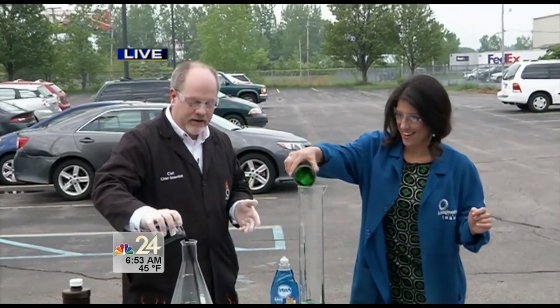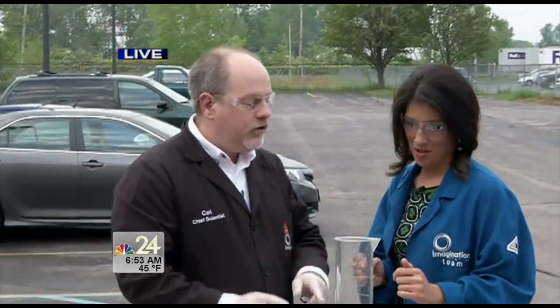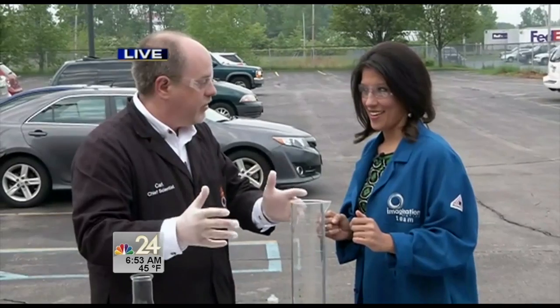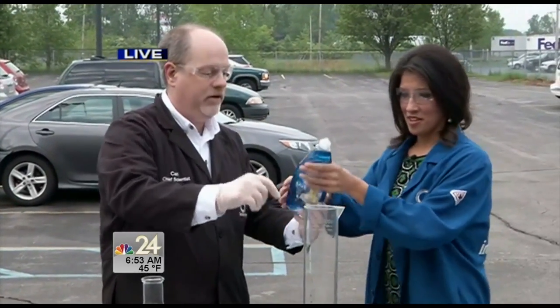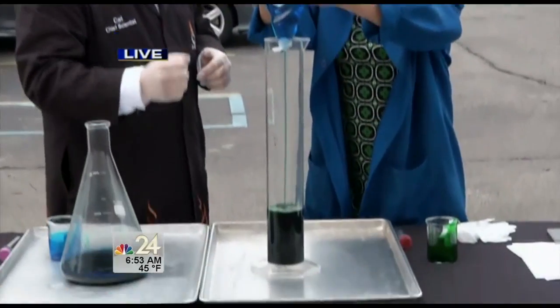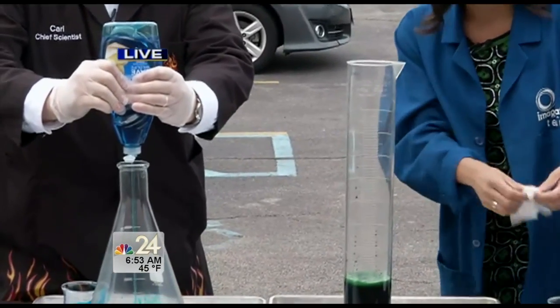The hydrogen peroxide is actually H2O2 — sounds a lot like water, right? But it has an extra oxygen atom. What we're going to do is release that extra oxygen atom to create a lot of oxygen gas. We want to capture that in some soap, so go ahead and add a big squirt — a huge squirt — down inside there.